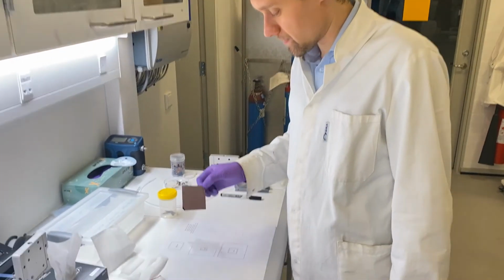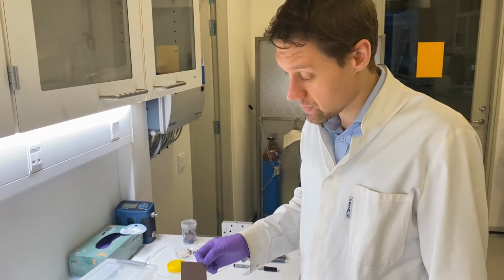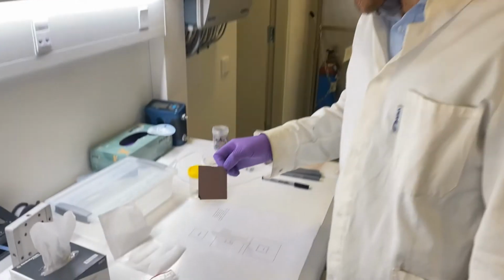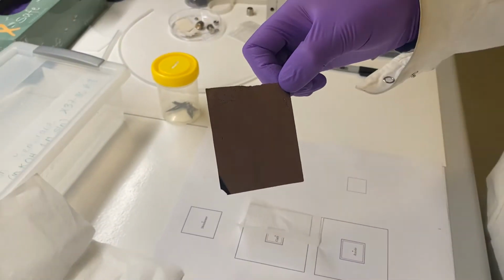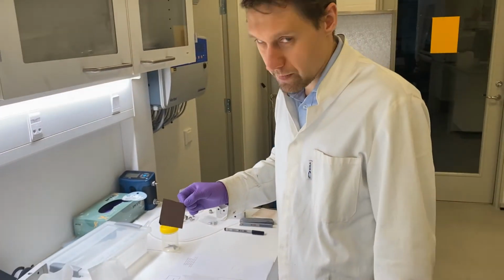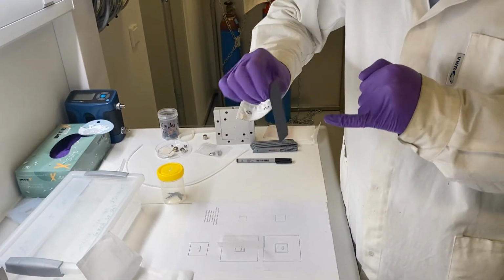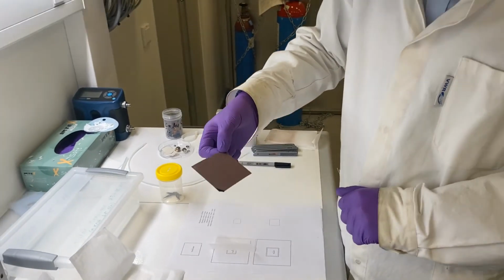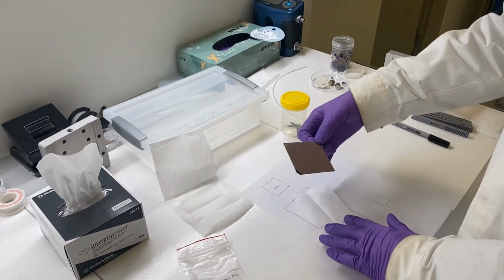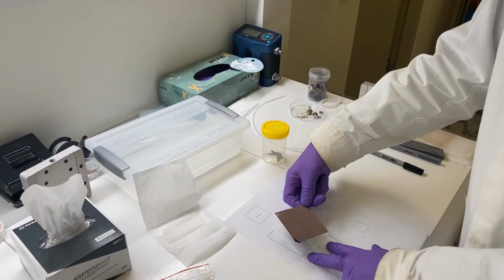We need to cut the electrodes. And first we cut the cathode. In the experiment we're going to do today, it's sputtered copper on a gas diffusion layer, so it's a Sigracet 39BB, and these are very fragile, so you have to be careful not to puncture them. It's a carbon cloth with PTFE, so Teflon strings inside, and we've sputtered a thin layer of copper on top of it. But first we need to cut it out in 1.5 times 1.5 centimeters, and the area here is what is important when we're doing the experiment later on.